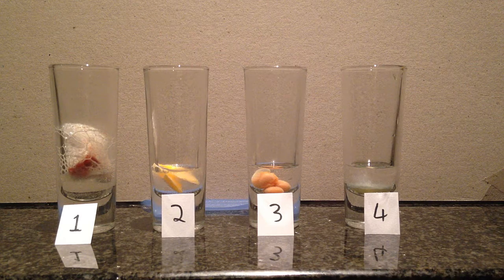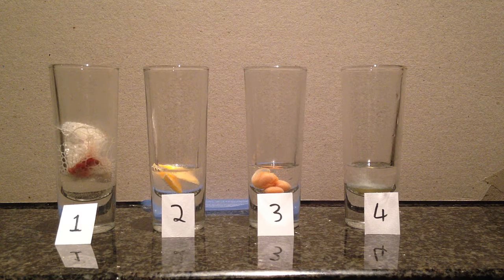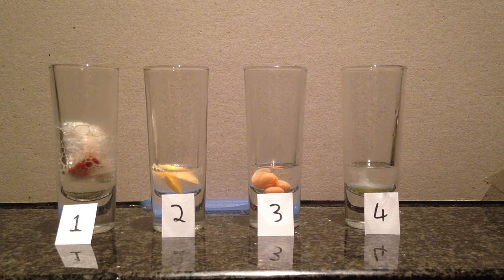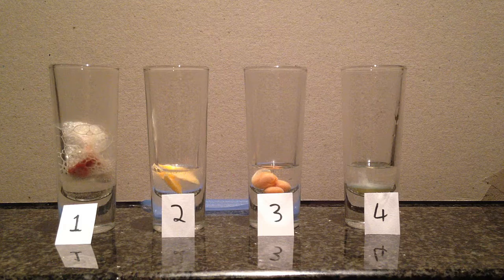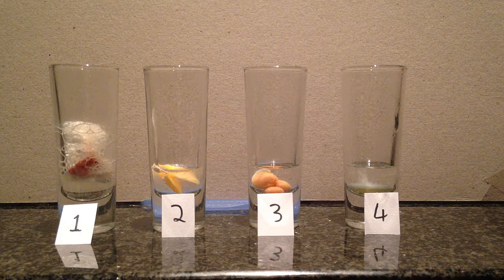Okay, number 1 definitely had the most. Number 2 was definitely second. Number 3 actually has nothing. Number 4 looks like it's doing something very slightly. They have to be raw because the catalase enzyme will denature at high temperatures. So the egg has to be raw, and so does the chicken liver.